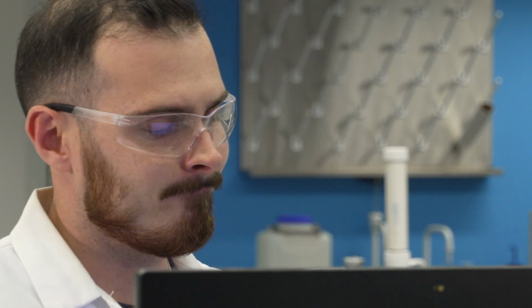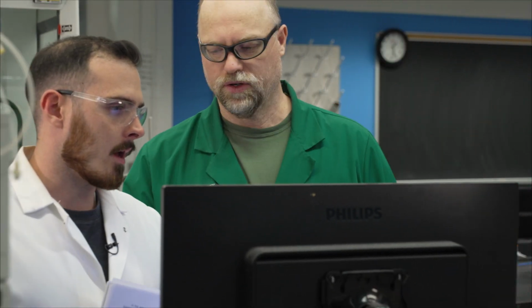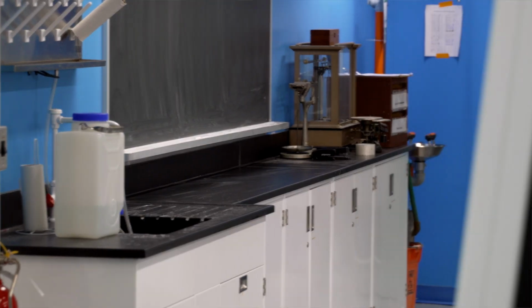Lastly, operating the TOC instrument can sometimes be tedious and confusing to new users. Once your vials are ready for analysis, ask your TA or lab coordinator to help you get your samples running. Now it's time to sit back, relax, and get some studying done. It'll take some time before your samples are fully analyzed.